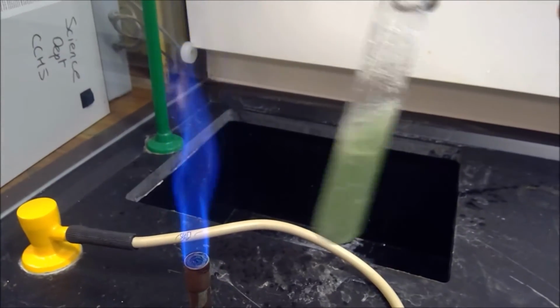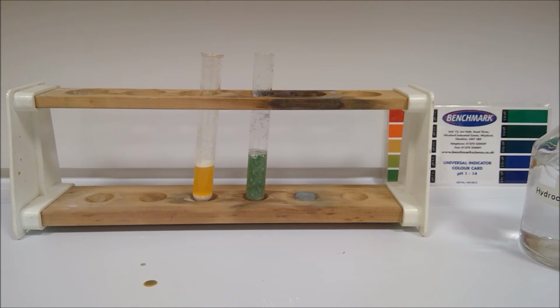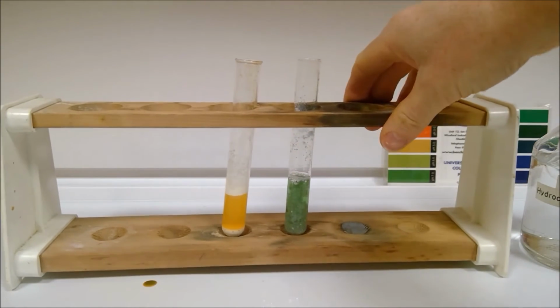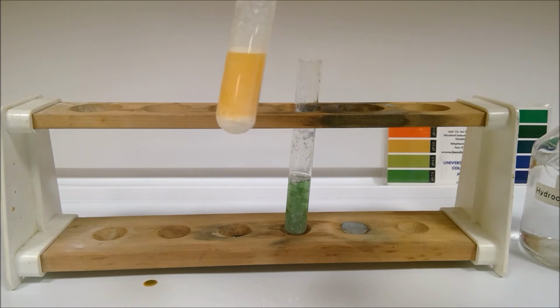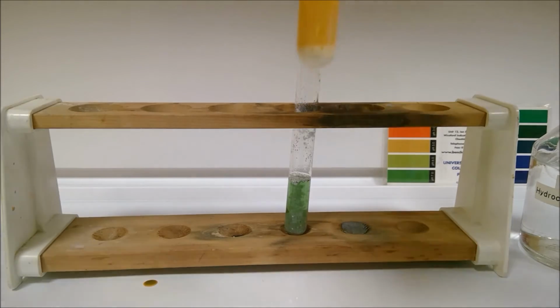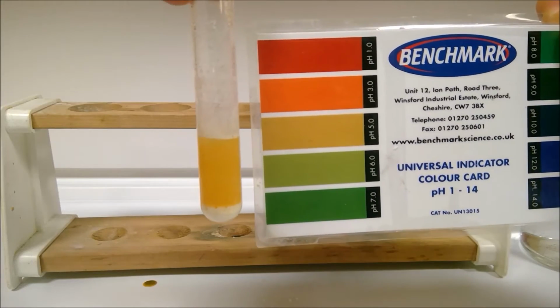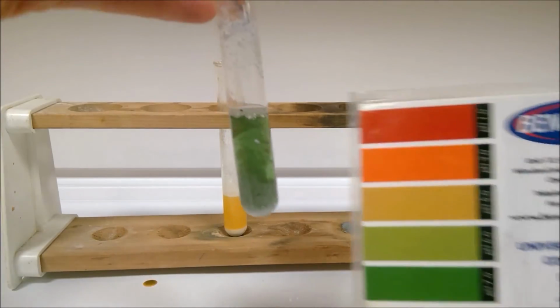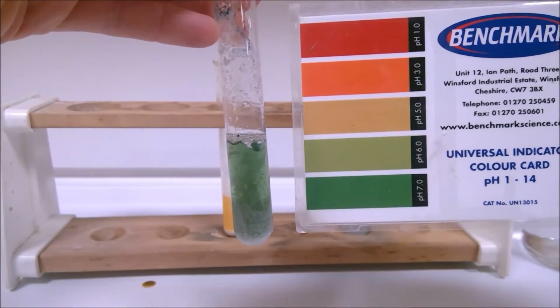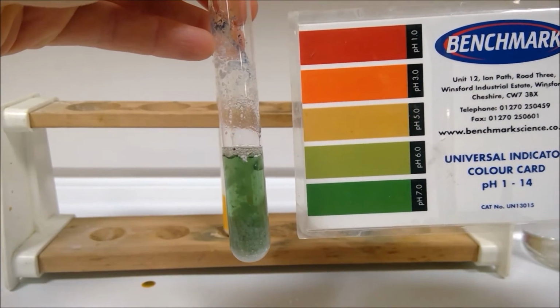Alright, I'll stop heating there again before that one bubbles over. Okay, so we have both tubes back on our test tube rack now. So this one was part C. Okay, so record your final pH here. And then we said we'd just revisit part B after heating as well. So you can just see if you are happy with the final pH that you recorded earlier there. So this one's part B.